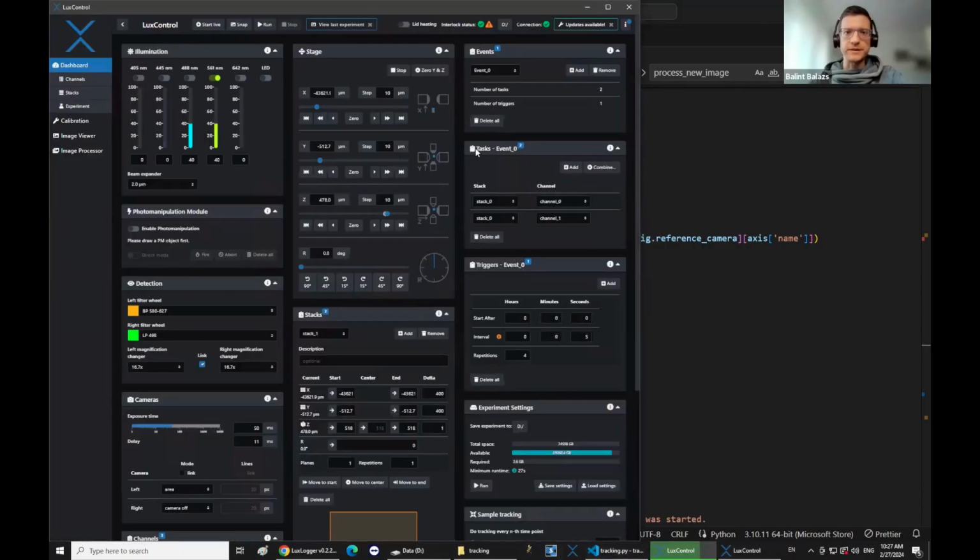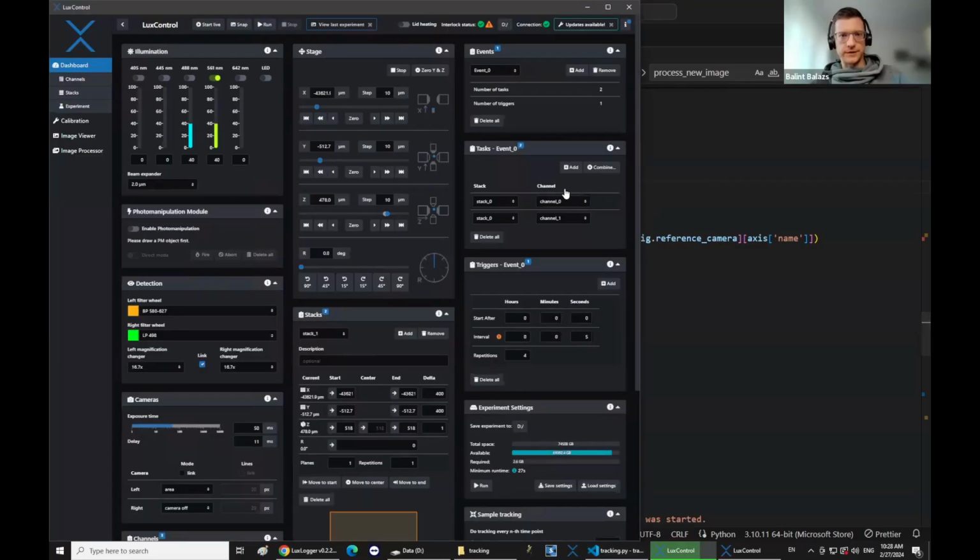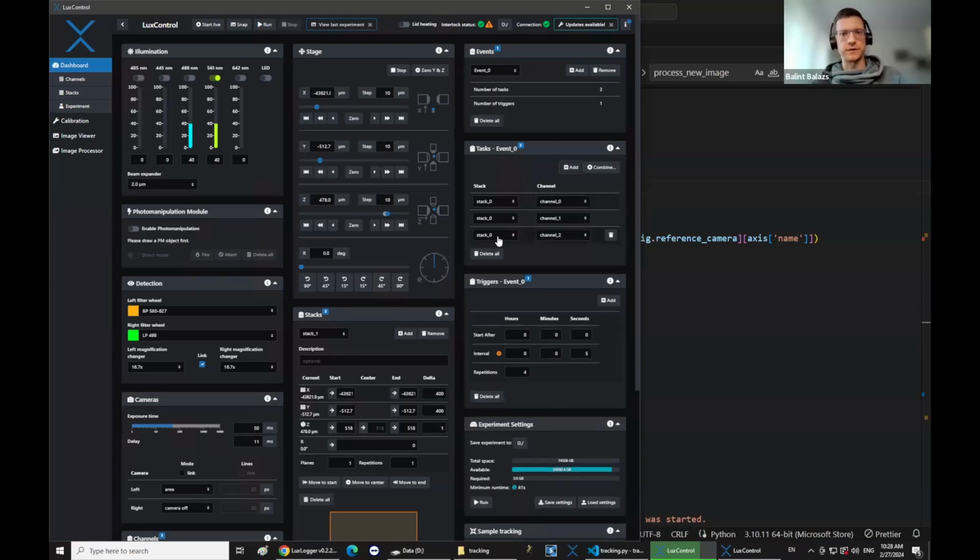Sorry, what do you mean by that? Sorry, so you just add the new stack to the list of next acquisitions, and you don't update the stack position to be acquired that was initially set. So the stack list is defined in the user interface, and so you can just have as many as you want.